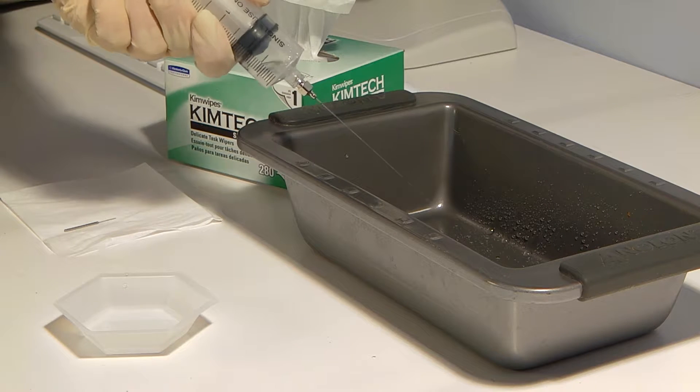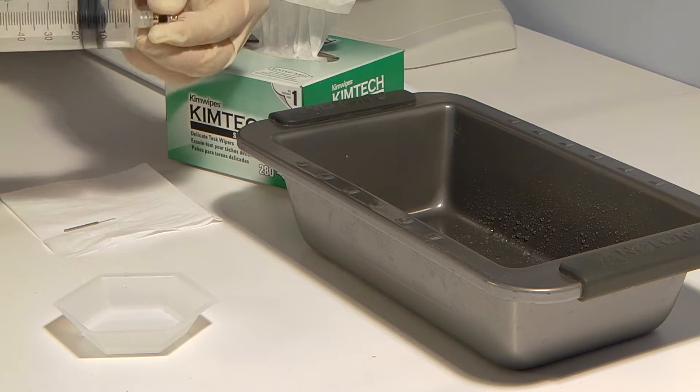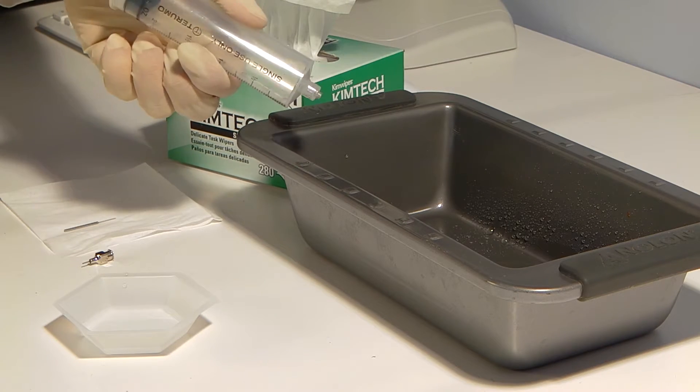Blast the cleaning solution through the reference probe several times. Then unscrew and take off the reference probe and empty any remaining cleaning solution from the syringe.